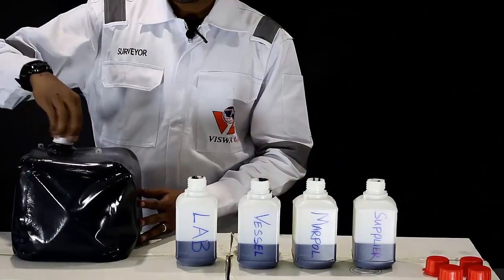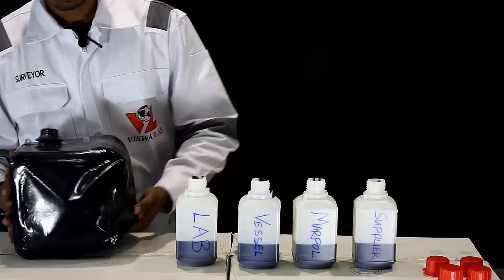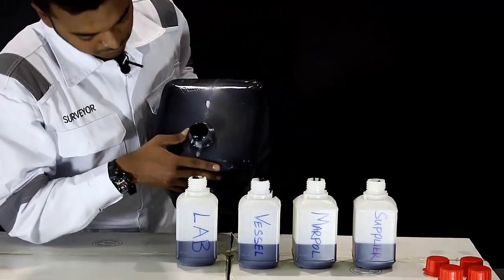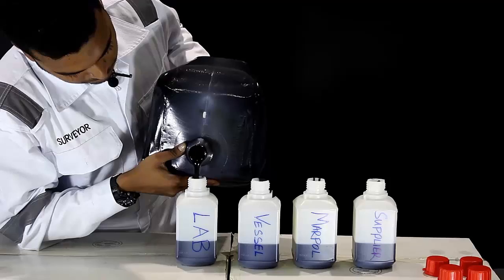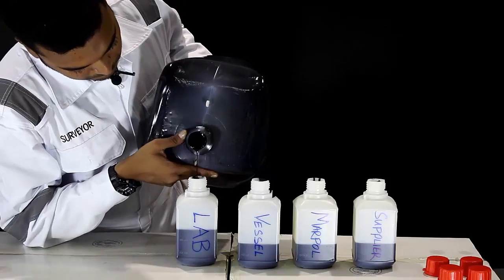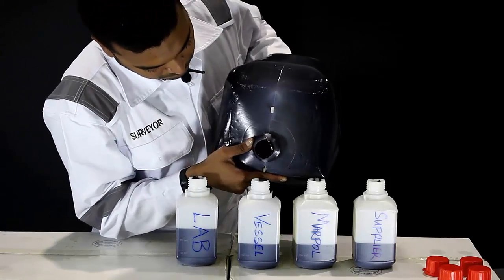Shake it vigorously for a third time and pour another 25% into the bottles.